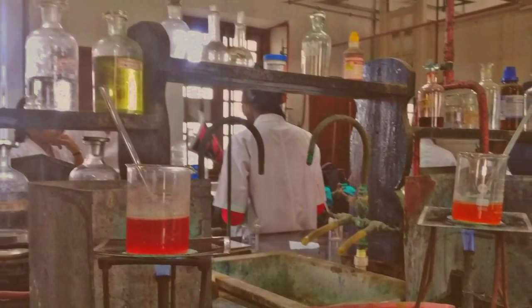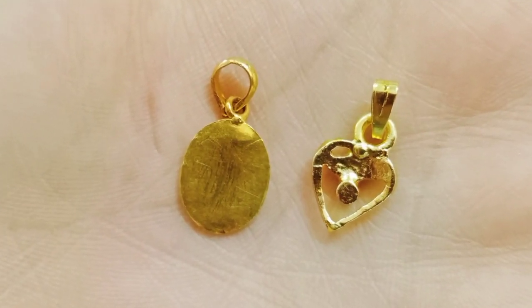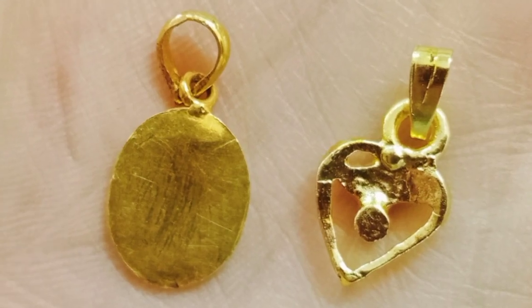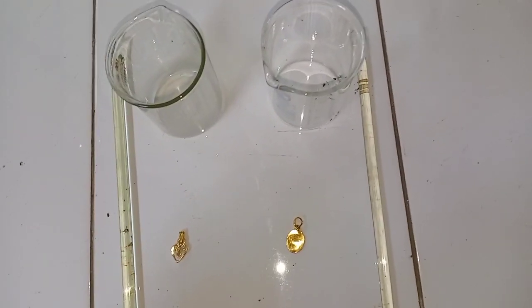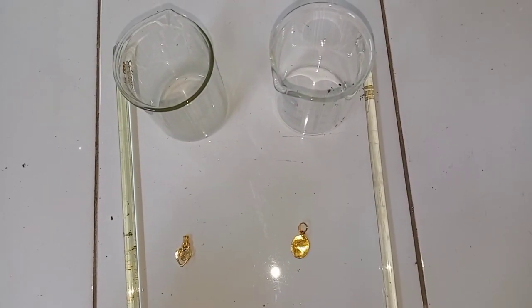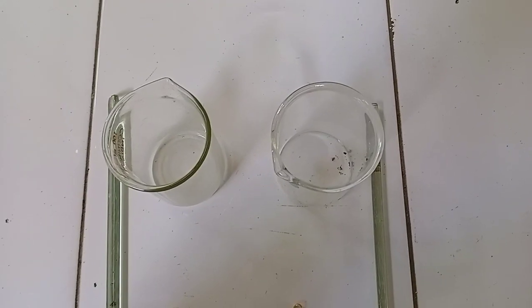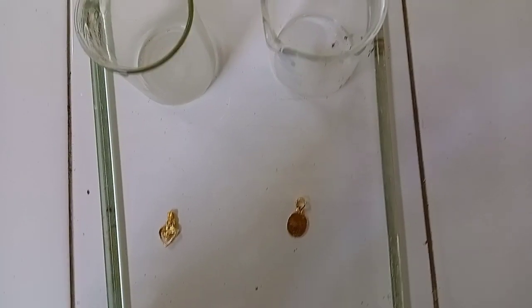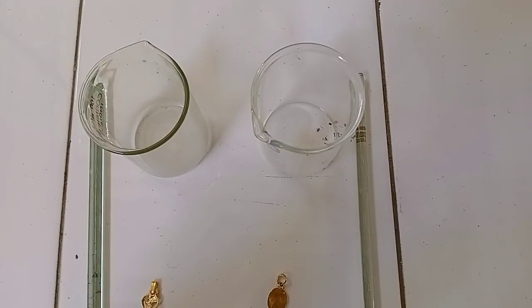All we need is the material which we are going to test — the material which we found — two beakers and two glass rods. Here I am using two materials: one of which is gold and the other is not gold. You are going to find out by this experiment.